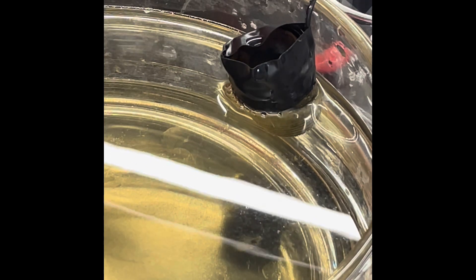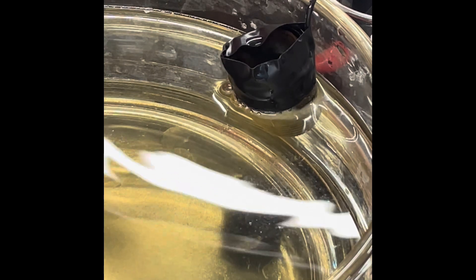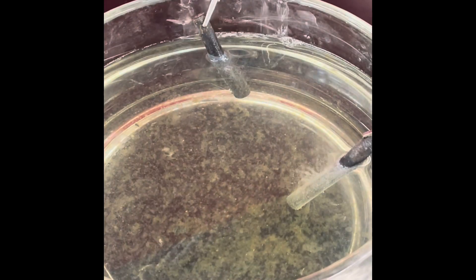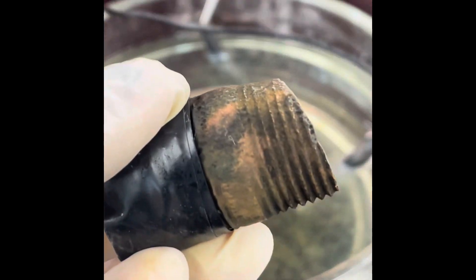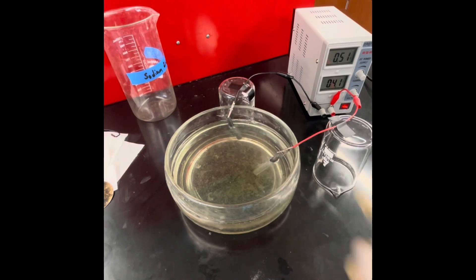After about 20 minutes of trying to get something to happen with the copper electrode, I switched it out for a stainless steel plate. Because of the reaction happening, most electrode materials should have been fine, but I was still not able to get any zinc to plate out or any meaningful amount of oxygen produced, whether using the stainless steel plate or the piece of copper. When I used the stainless steel plate, I actually got a little bit of corrosion — you can see a little bit of suspension in our sodium zincate, probably some iron compounds. So I finally switched the anode for a piece of graphite, and still very little bubbling occurred and no zinc metal was able to form.